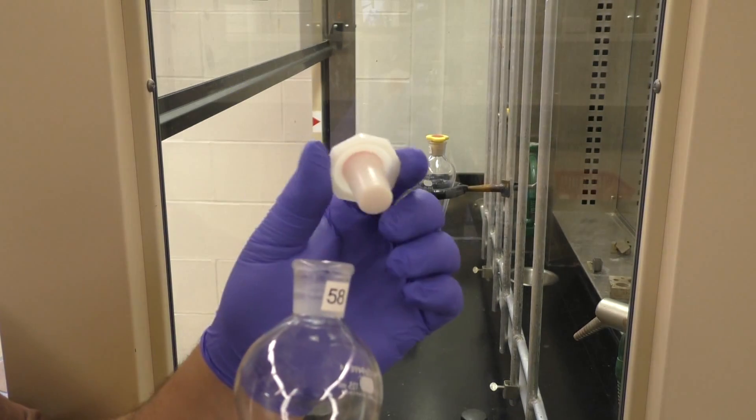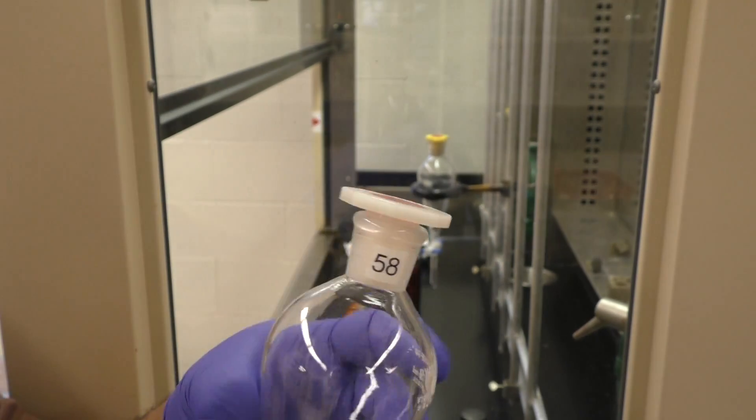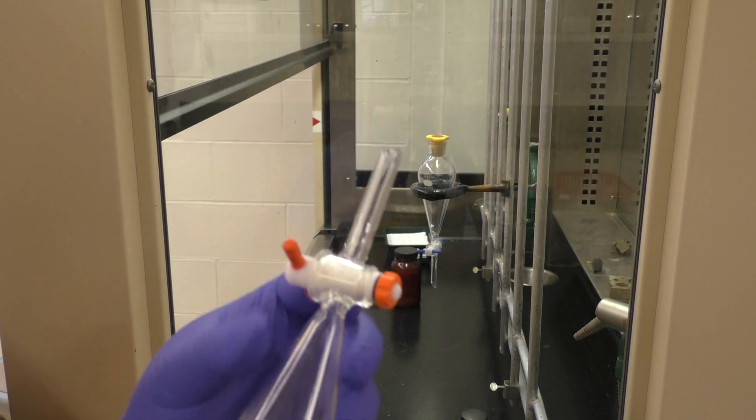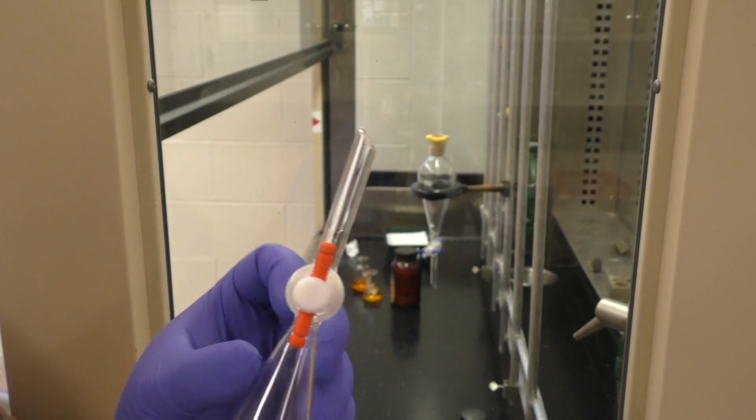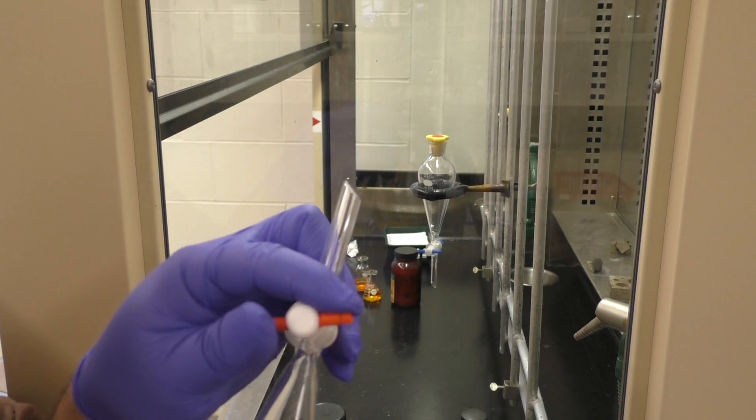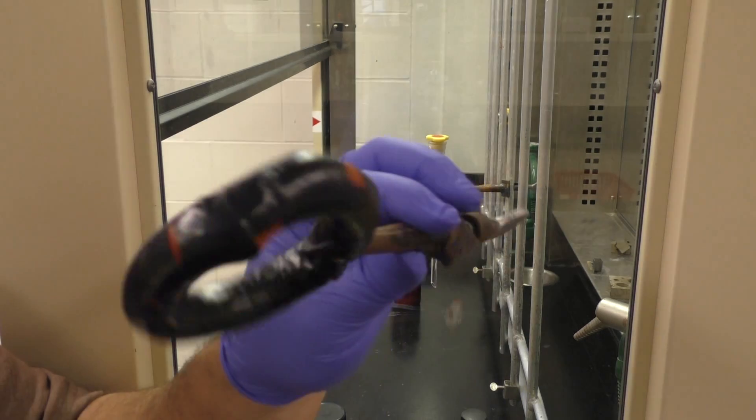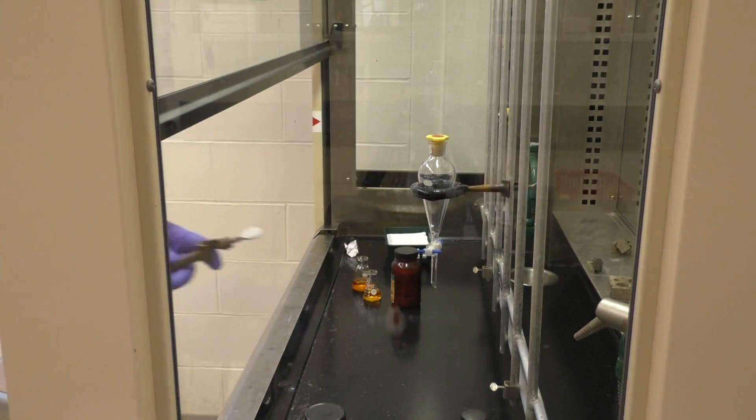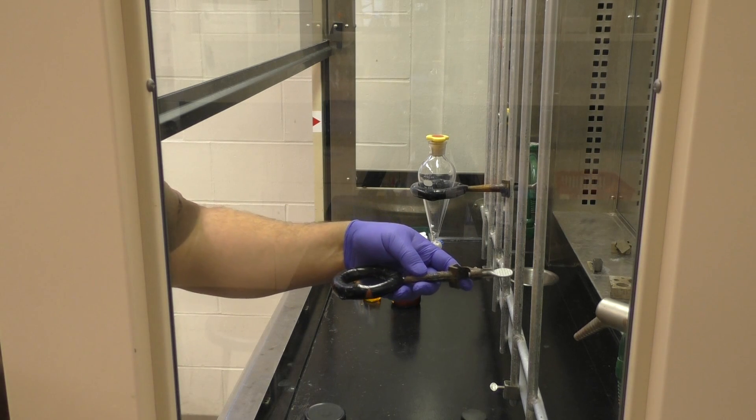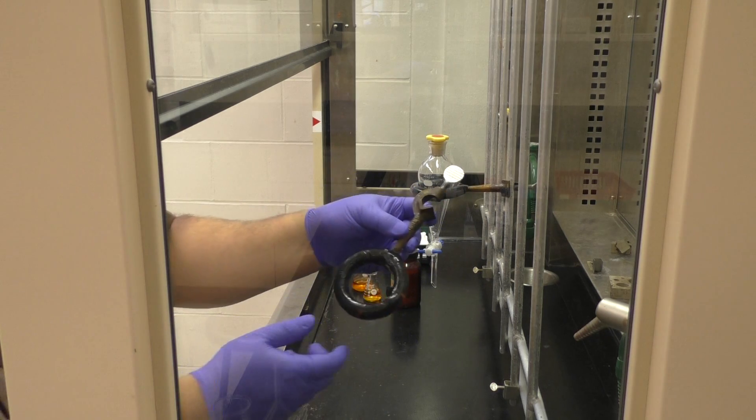At the top we've got a stopper, plastic. Notice the lid does not come down flush with the top of the joints. When you get it, you can adjust the tightness. If it feels like it's not getting very tight, just check with your TA. Or, actually better yet, maybe try adding some water to it. Just distilled water. And see if it leaks.